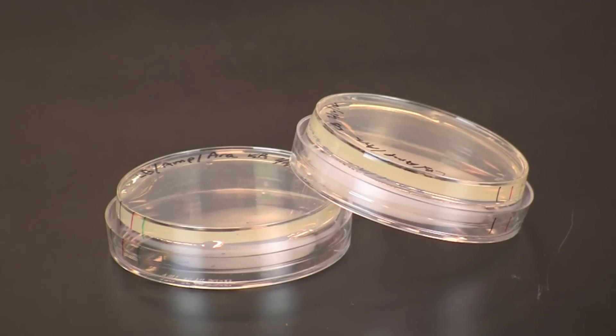Allow the plates to dry for two days on the lab bench, then wrap them in plastic and store them upside down at four degrees Celsius.